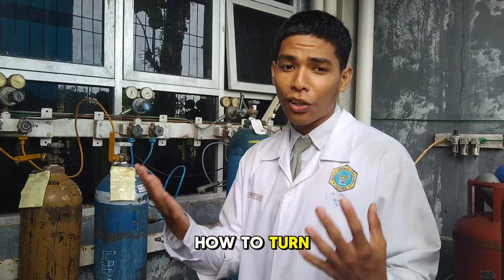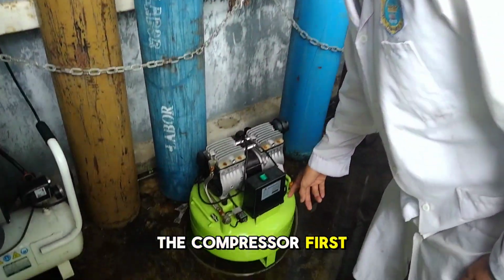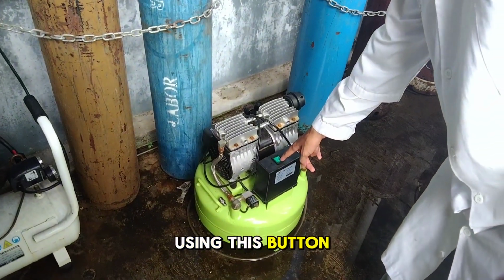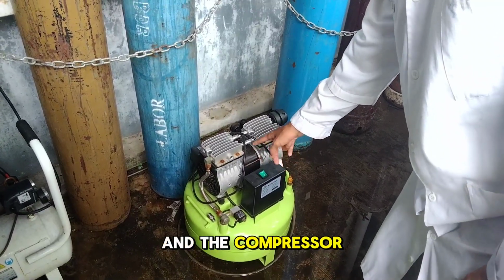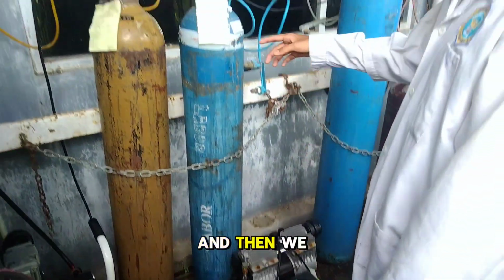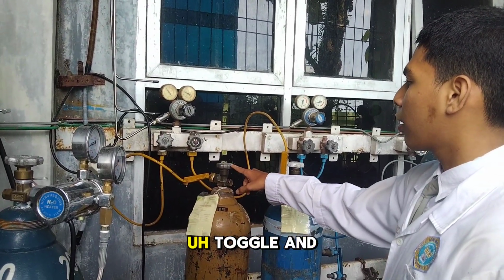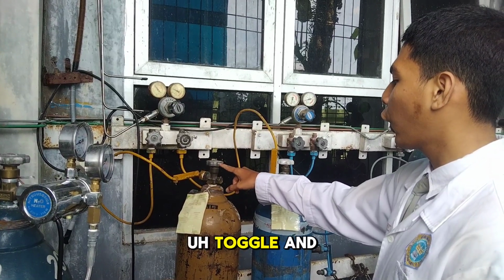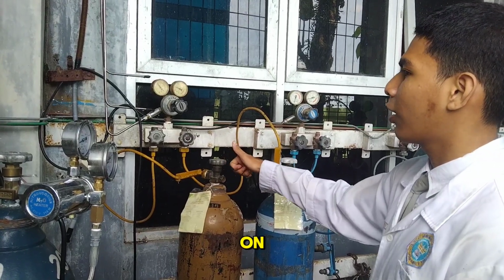How do we turn on the gas? We need to turn on the compressor first. Using this button, we switch it up and the compressor will be on. Then we spin this valve, and the gas will turn on.